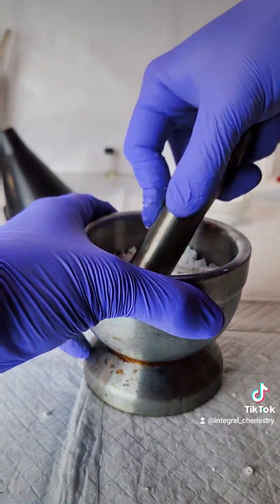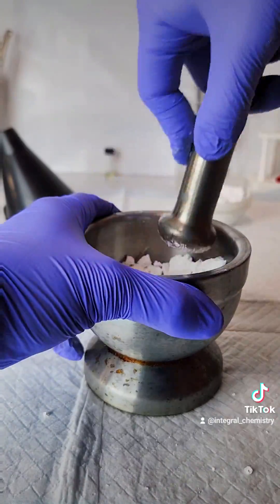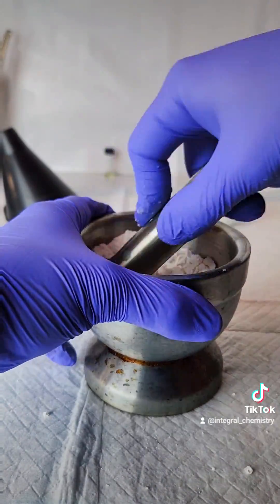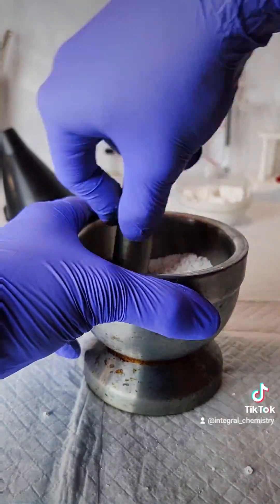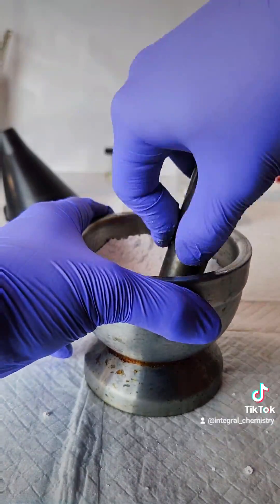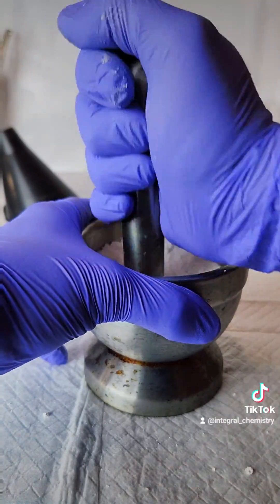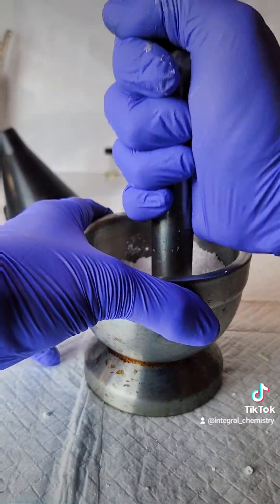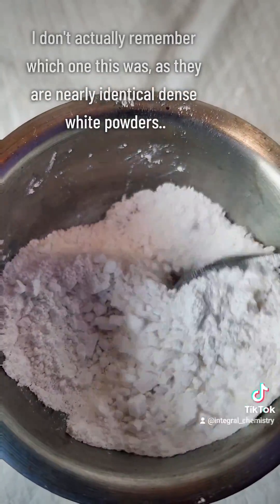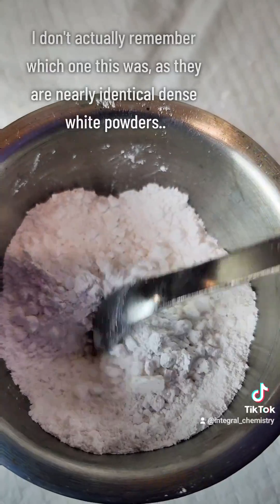I used two old aspirin containers for storage, and you can pretty much use whatever you want, as these salts are very stable and not hygroscopic. I also got an extremely high yield for both, as this reaction is incredibly efficient.